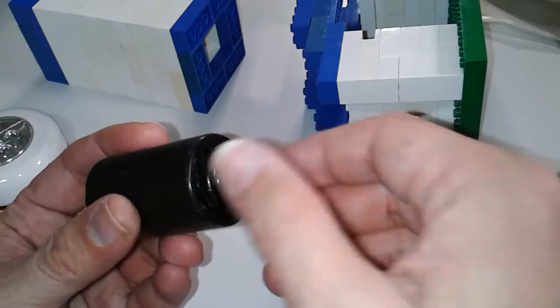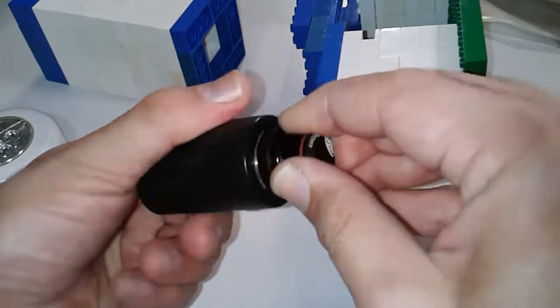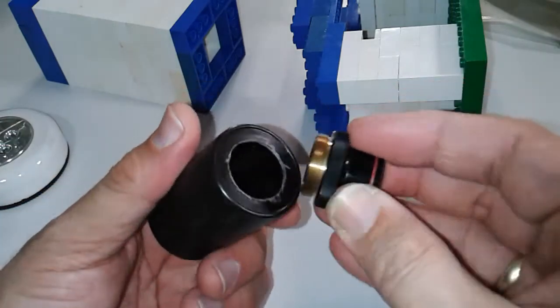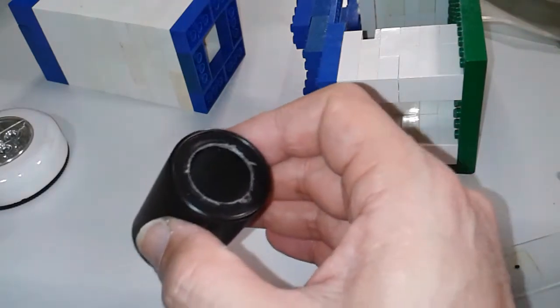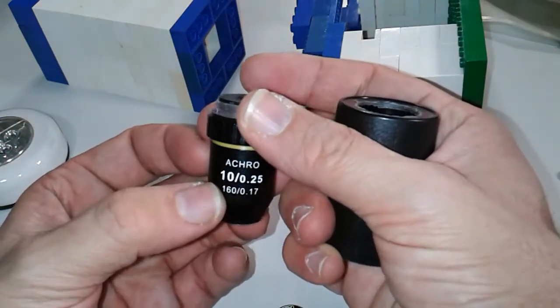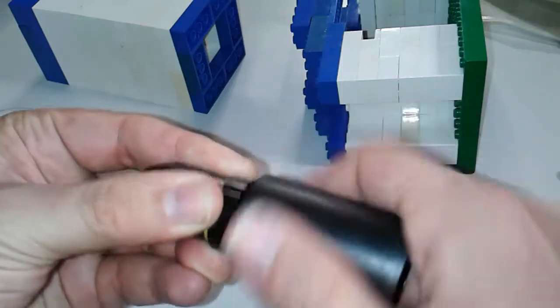How did I do that? It was a little bit of delicate work. You can screw it in like this. I used a compass and very carefully cut out a round hole here, just the right size — a little bit smaller so that you can actually screw it in. You can also attach a slightly larger objective. This one is a 10X objective, which gives a total magnification of 100X because the eyepiece also magnifies 10 times.